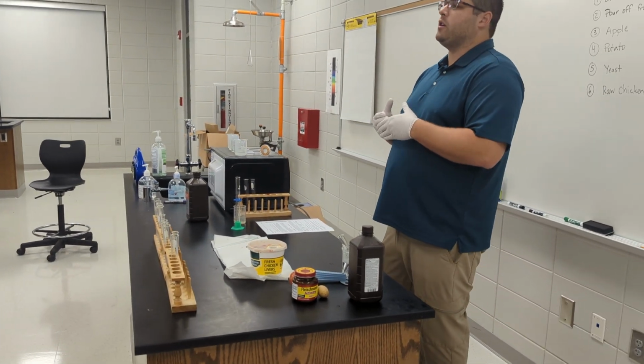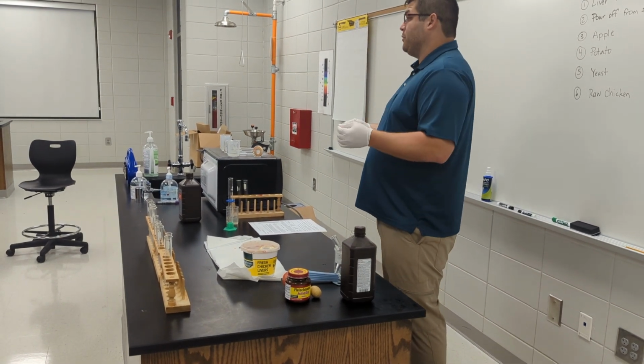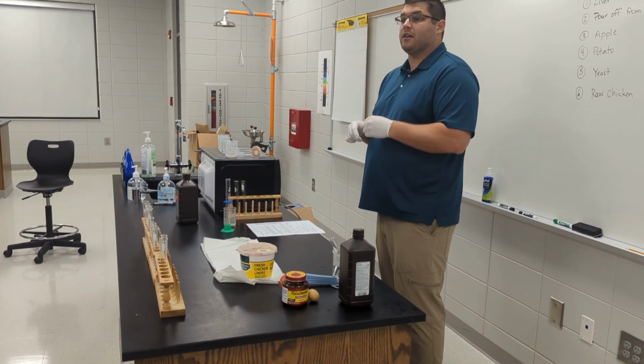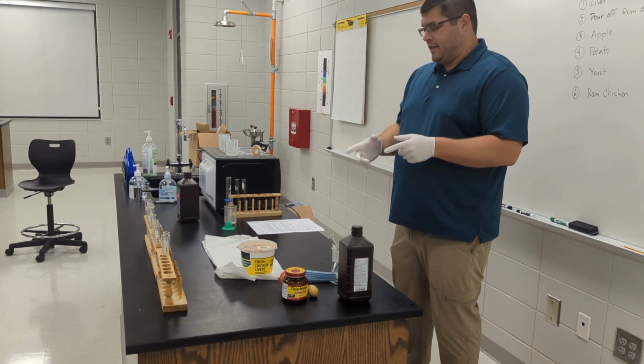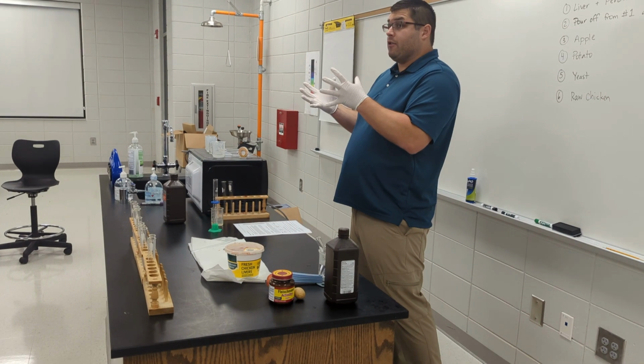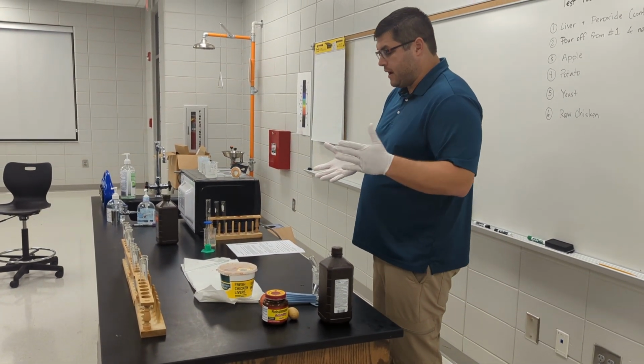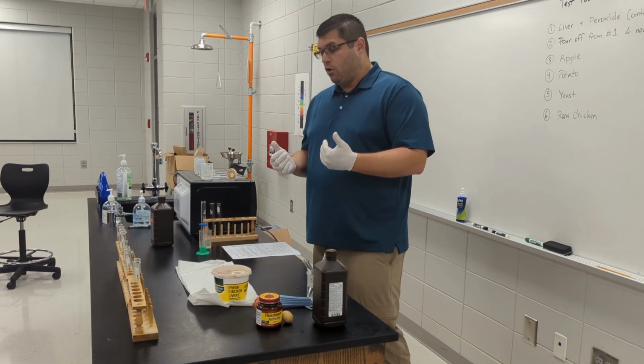So what we're focused on is the oxygen being produced, and that's going to be the presence of bubbles, which is what we're going to be looking for. So when it talks about rate of the reaction, I think it gives you the numbers from 1 to 5, 5 being it's really vigorous and intense, and 1 being not much is happening, okay? So we're going to establish a control first.